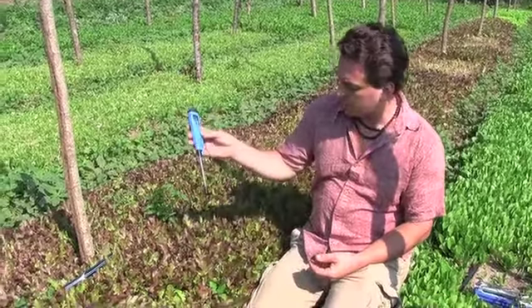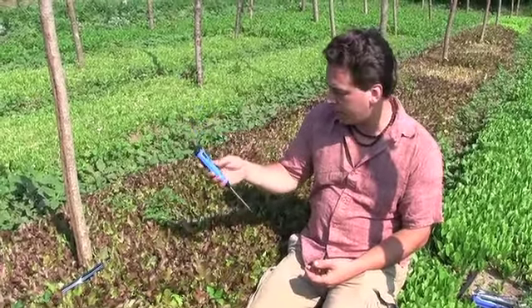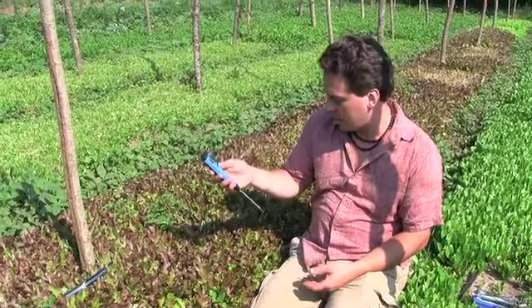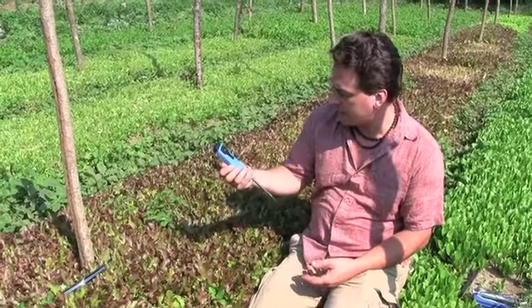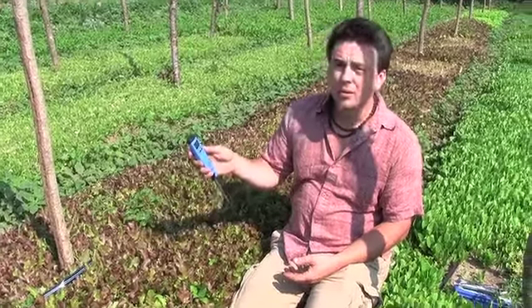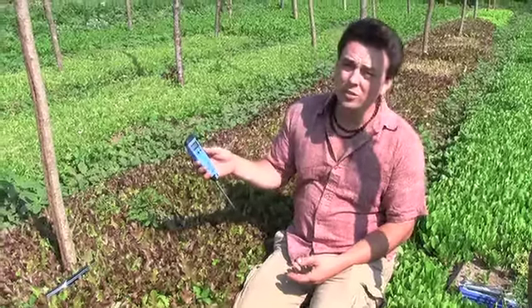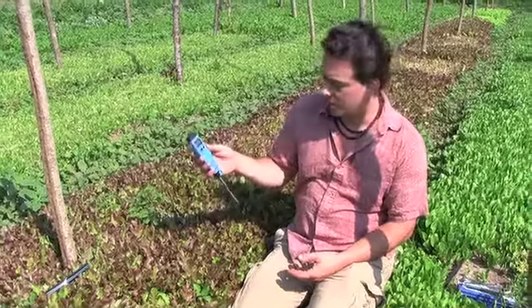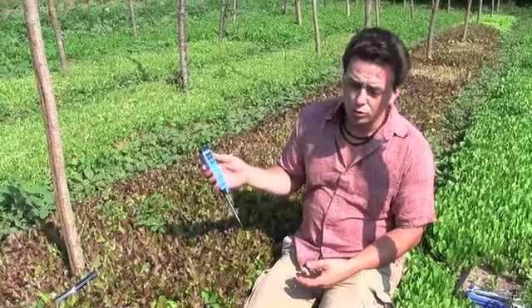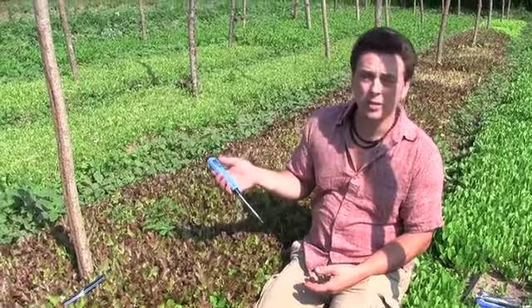This is a probe meter made by Hanna. I think it's a DIST-3. This is about $125 or so. And this is a very valuable tool to be using on a regular basis.